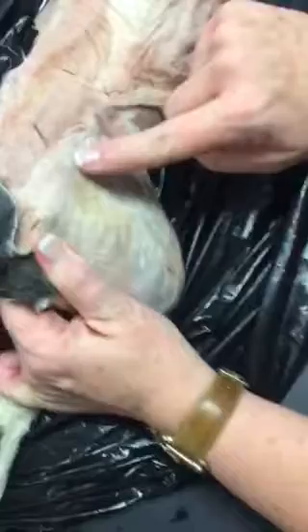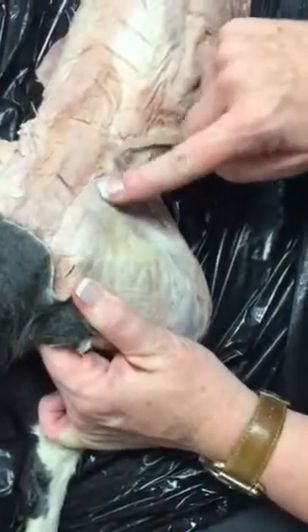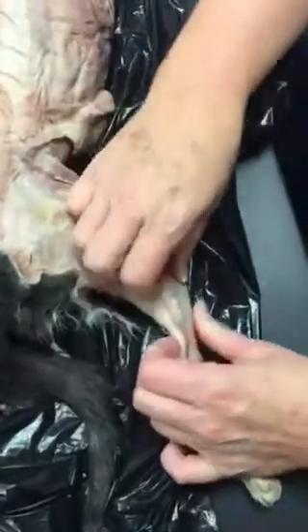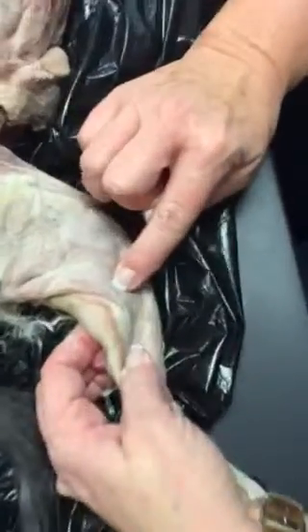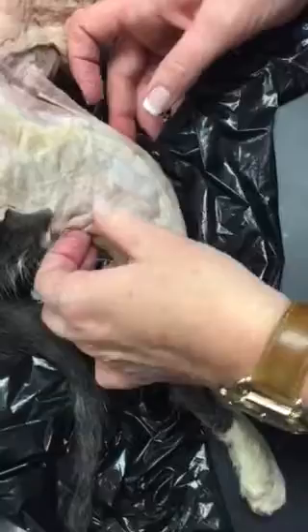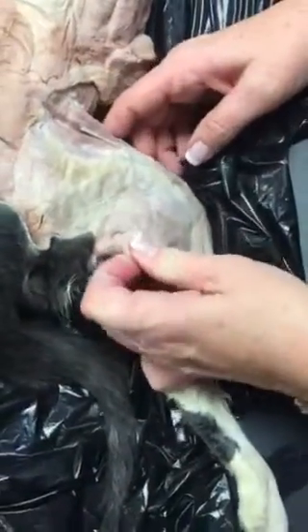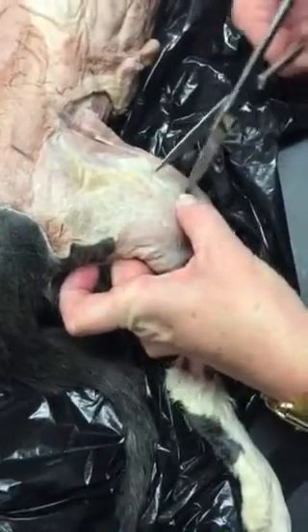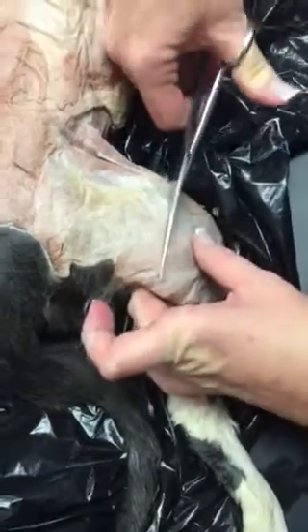You guys have not seen these yet, but we have a muscle in this area that's kind of heart-shaped, and that is tensor fascia latae. This muscle is the biceps femoris. We have the gastrocnemius. Then we have the Achilles tendon, and then I'll cut back the biceps.